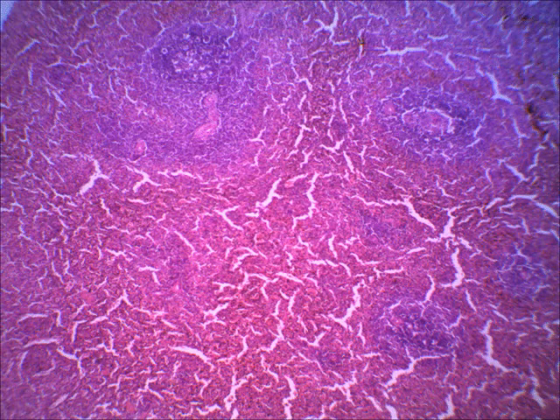Okay, so let's just put a W right there and a W right there. That'd be white pulp. There's a little area of white pulp. There's white pulp. And then all of the rest of it would be the red pulp.